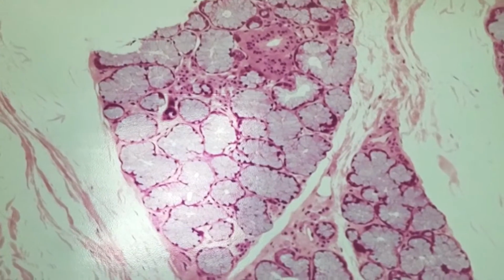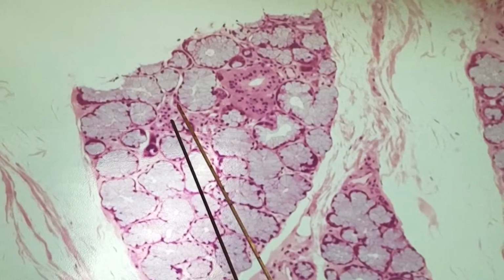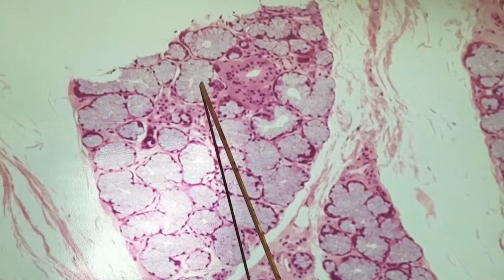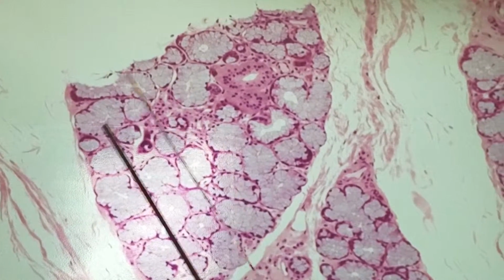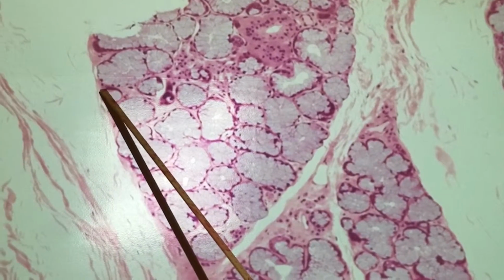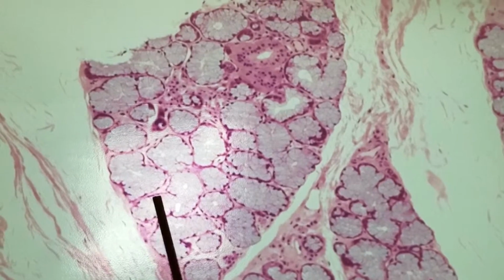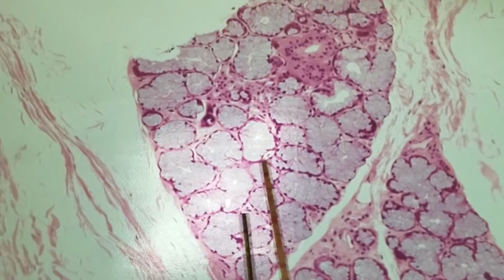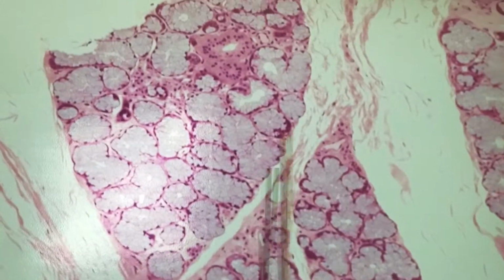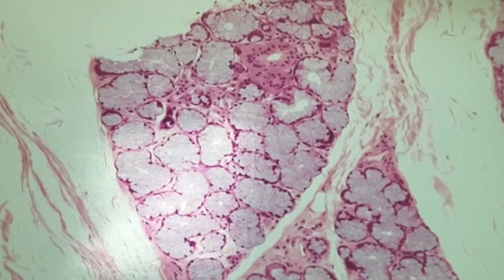So over here, just one more time, salivary duct. Actually, there's two of them. What are these? Mucous acini, and then that little thing, serous demilune. So you should know the difference. Sublingual has a lot of the mucous acini. Almost looks like a brain in a way.